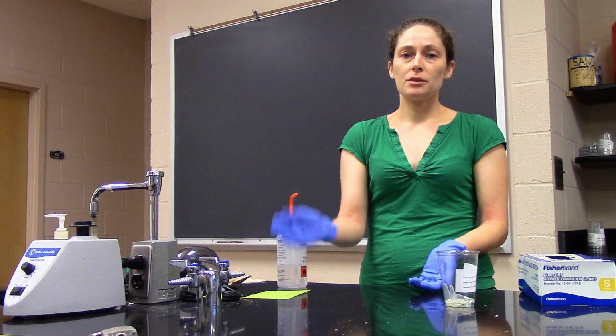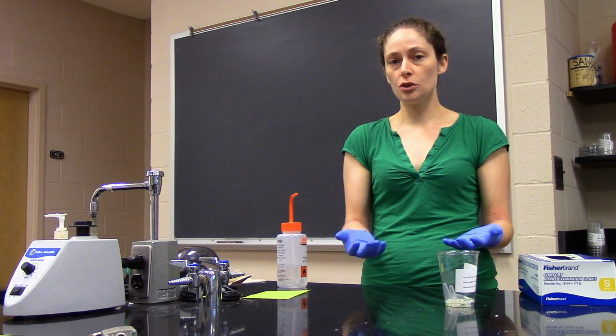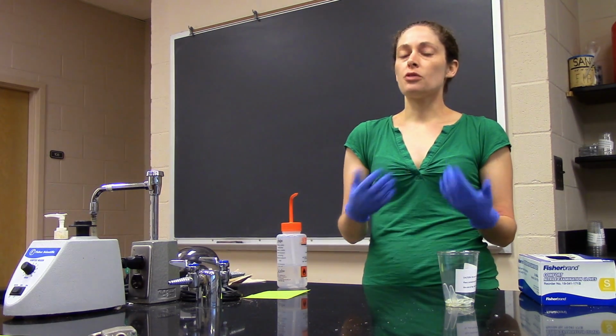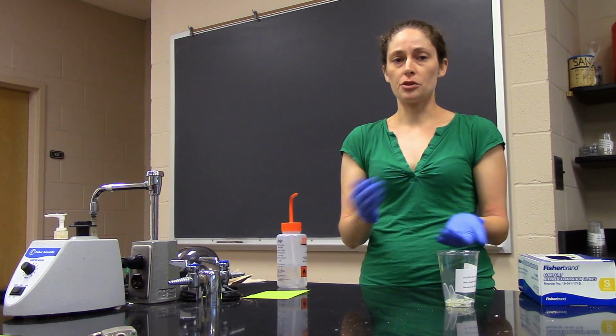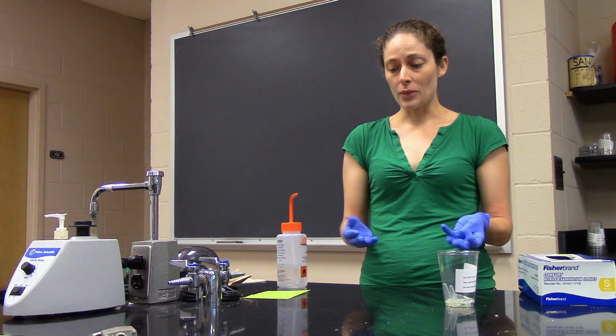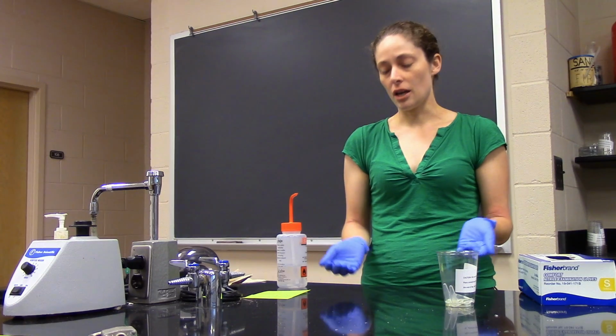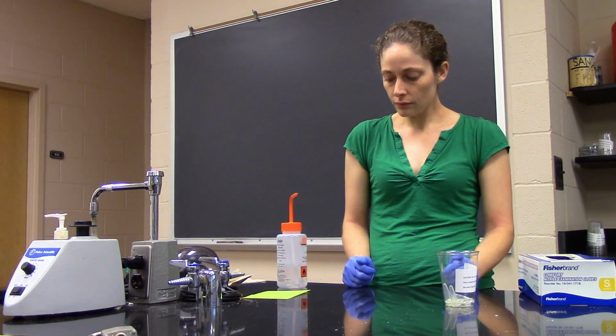Keep your pipette tips with the tops on whenever you're not actively using them. Same for tubes. Whatever reagents we try to consider sterile, you want to minimize their air exposure. So keep them covered, lids on, etc., when you're not directly using them. And try to work quickly also to minimize that air exposure time.